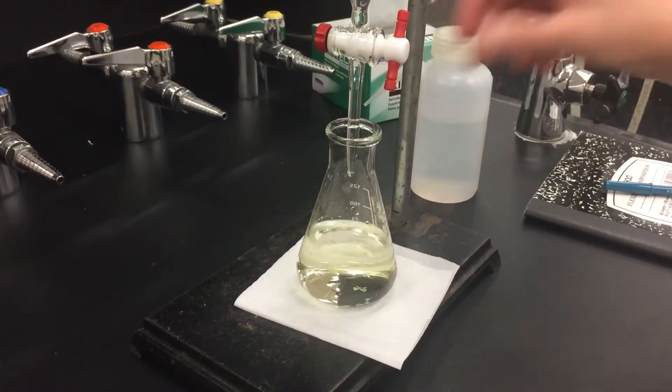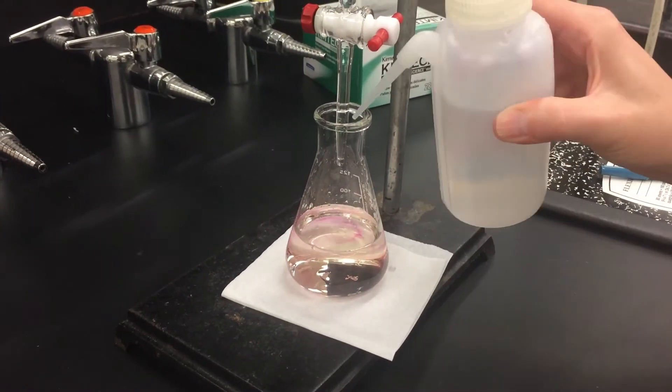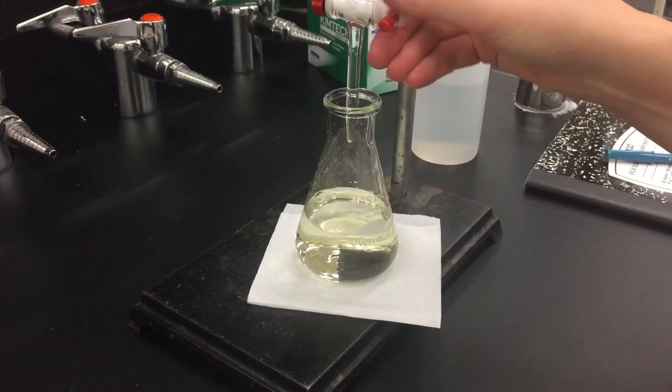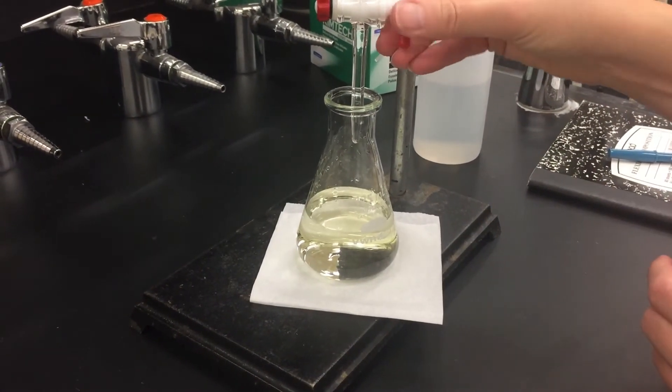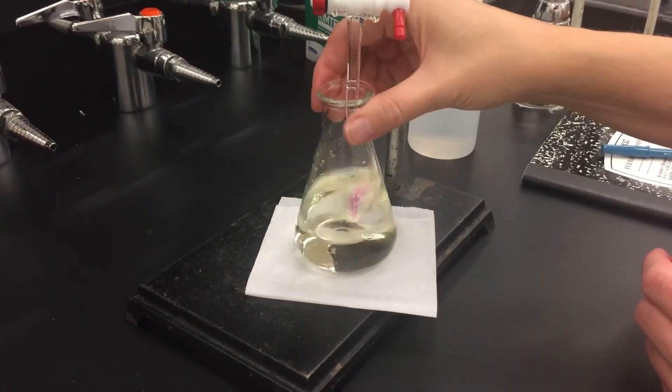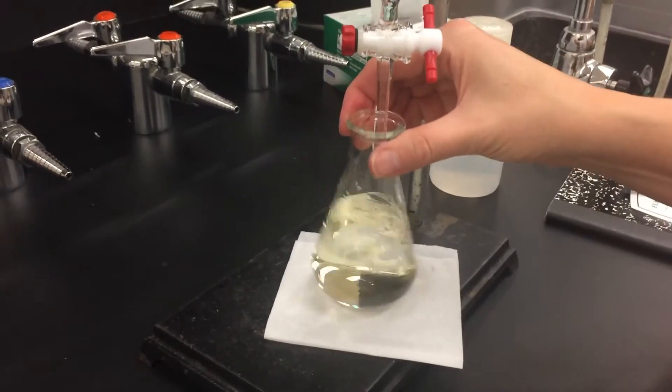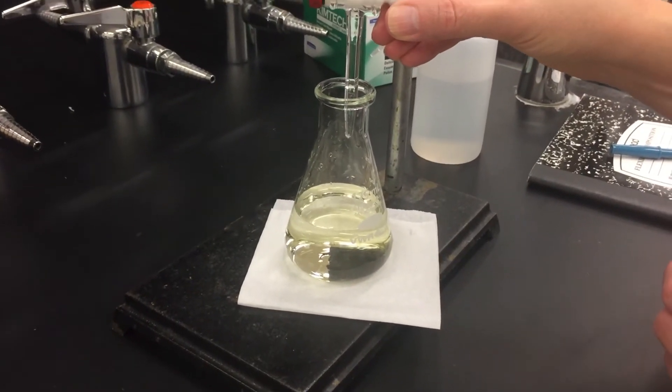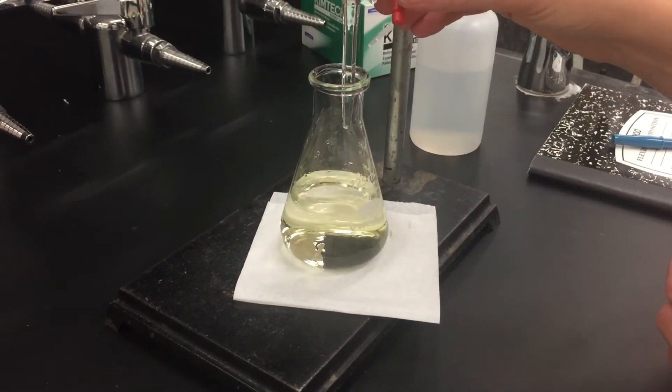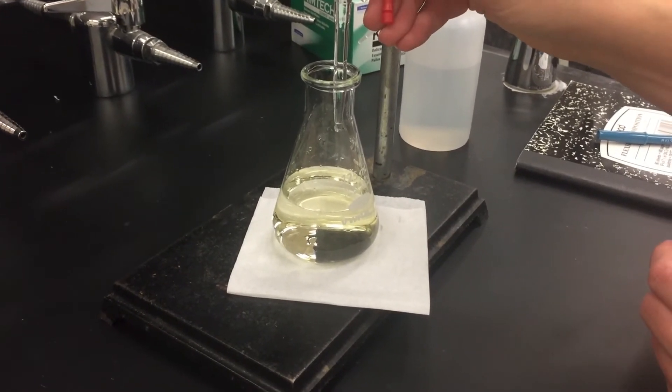Here I'm getting the sense that I might be nearing the endpoint because that pink color is staying a lot longer when I drip it in. So now I'm going to add just like one drop, swirl it really well, maybe rinse it because I know I'm getting close. We'll add one more drop, one drop at a time.